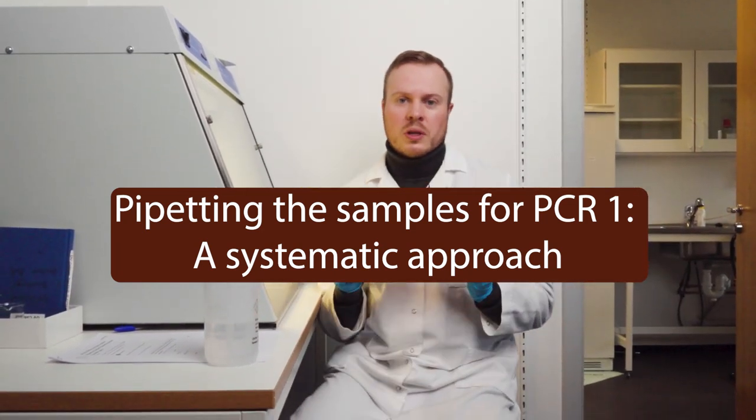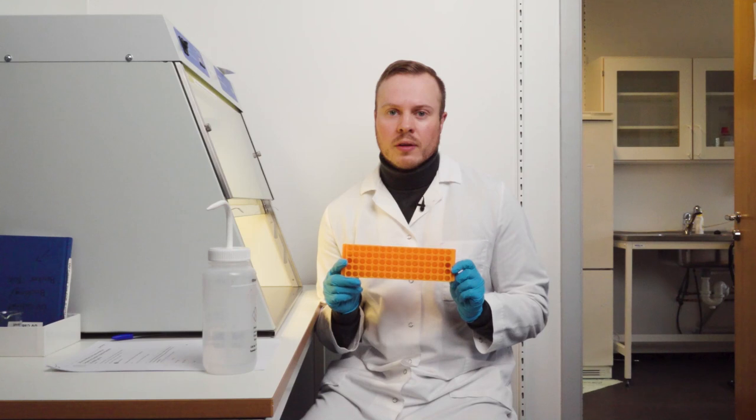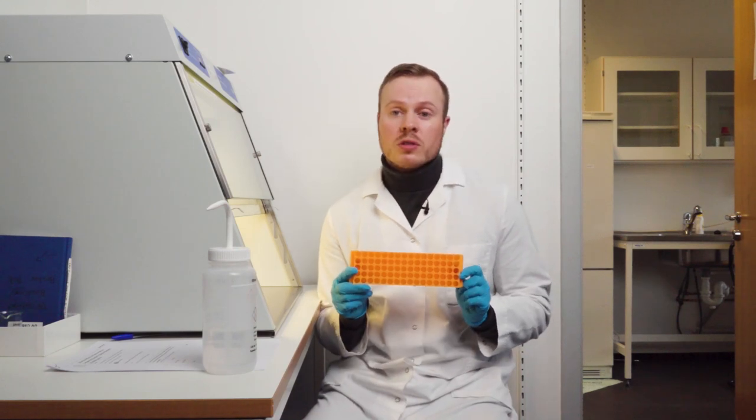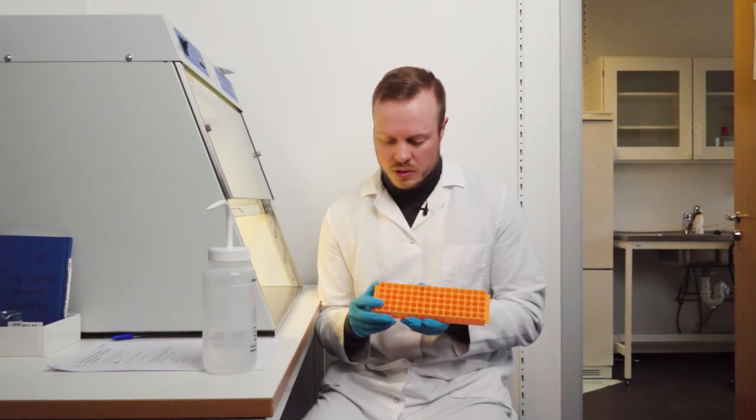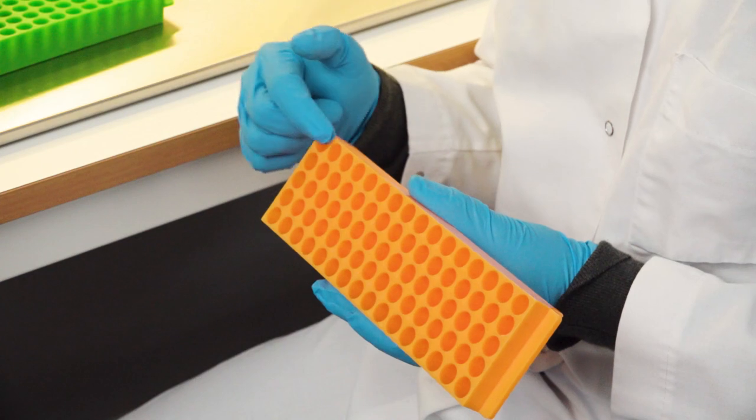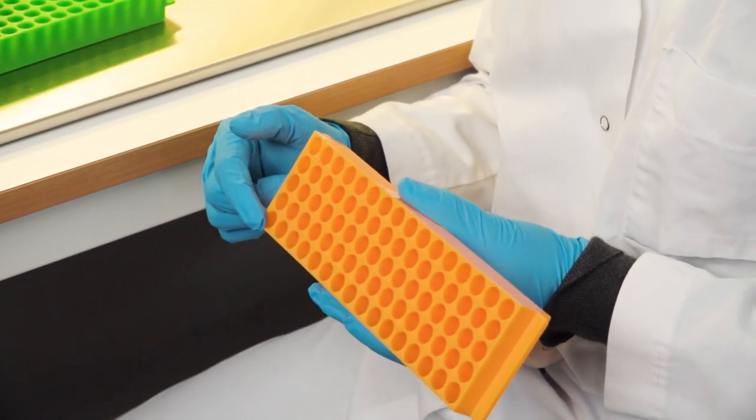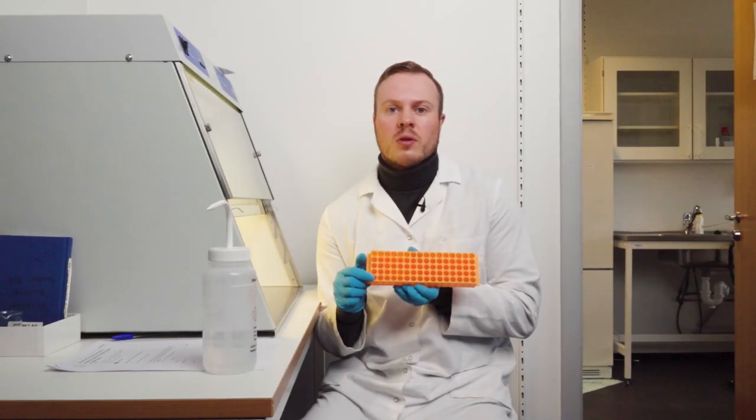I like to pick up another rack instead of using the box that I showed earlier. The reason for that is that I can actually move the samples from the top row to the bottom row, which also makes it easier to keep track of everything.